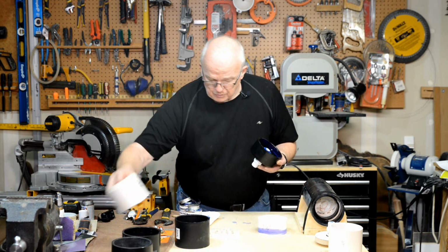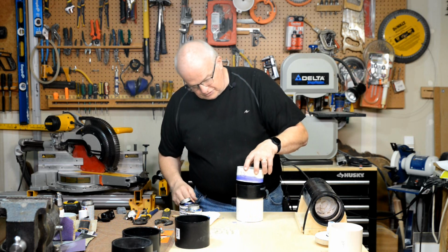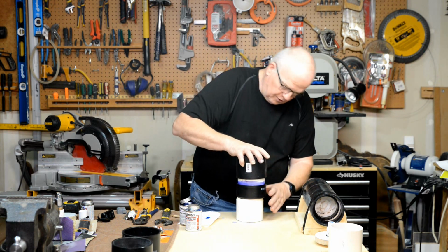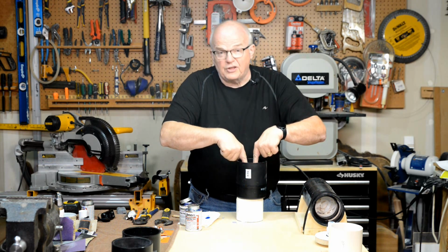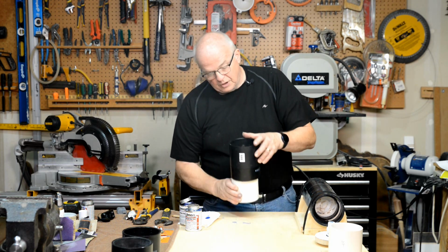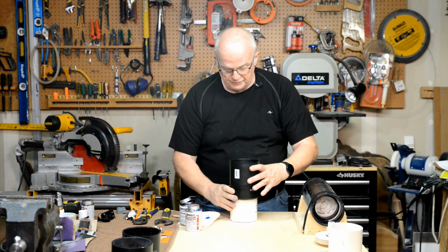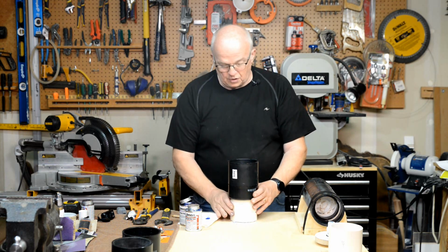So what I'm going to do is I'm going to take this, I'm going to set it down there like that. I'm going to take this, I'm going to put it there. Now work quickly. Put this inside of there, push that down, only as far as it'll go. Don't push that down in the middle, okay? Because you want that pipe to hold this piece here up against the ridge inside of here so that it doesn't move around, okay? So you can leave that there like that, and you're going to want to let that dry.